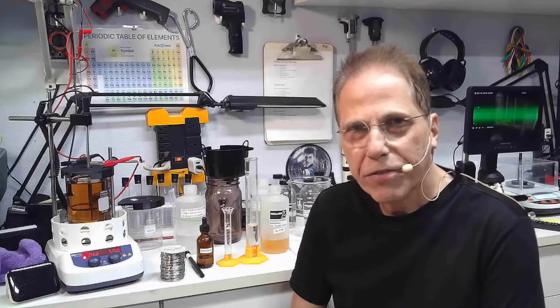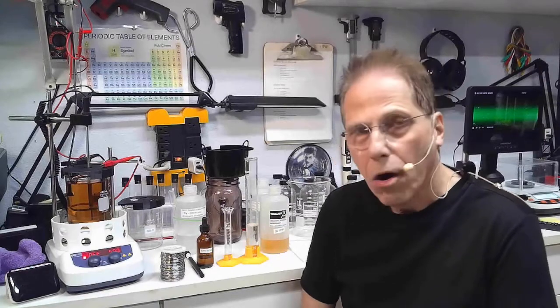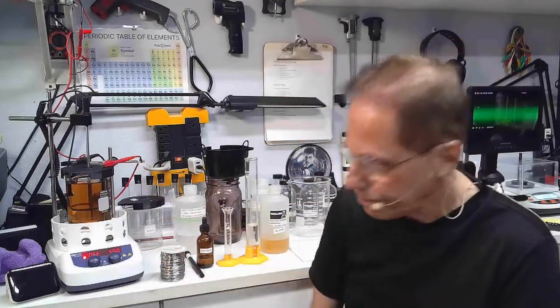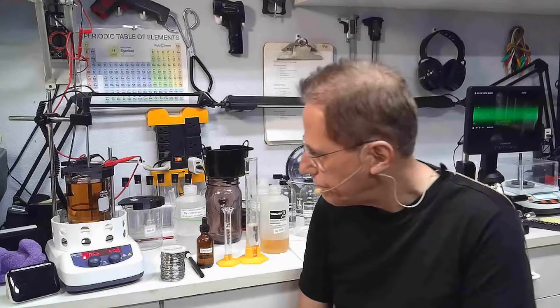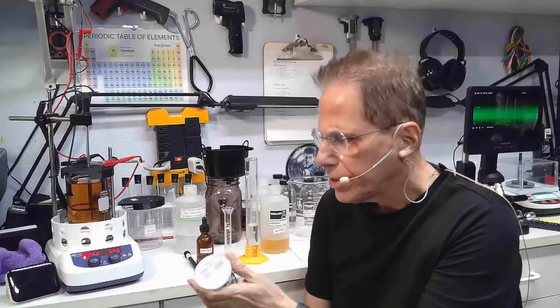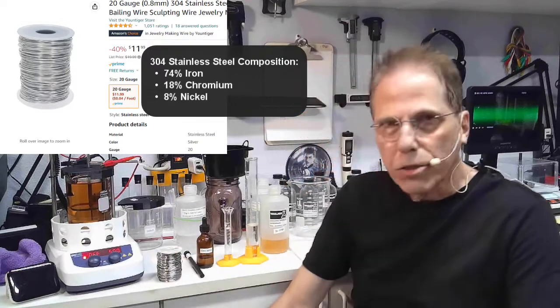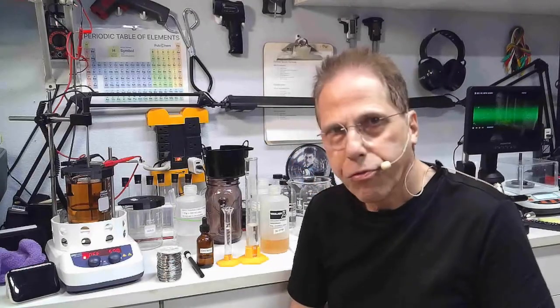Welcome to Reality Creative Video, I'm Hermes, and today we're going to do a start-to-finish on iron, chromium, and nickel. There is the actual finished product — that nice dark amber color. Basically, we're cooking iron with a couple of extra ingredients. I'm using 304 stainless steel; there are various kinds of stainless steel with different ingredients, and I chose this one because I want the nickel, the chromium, and of course the iron.